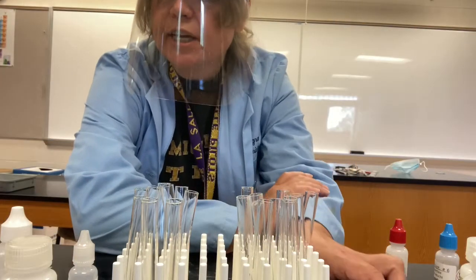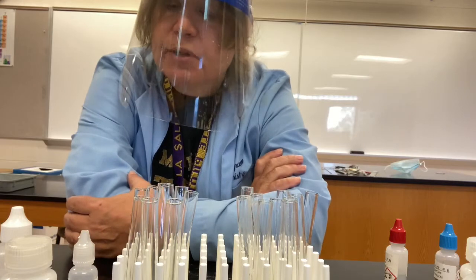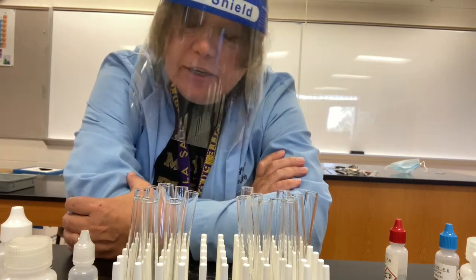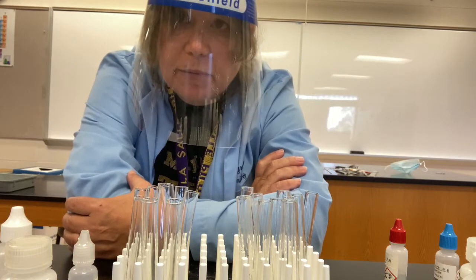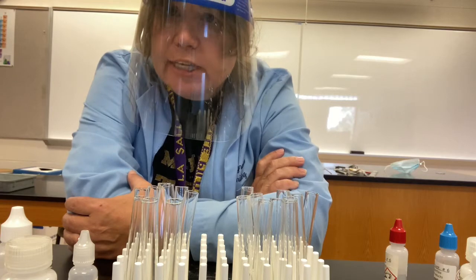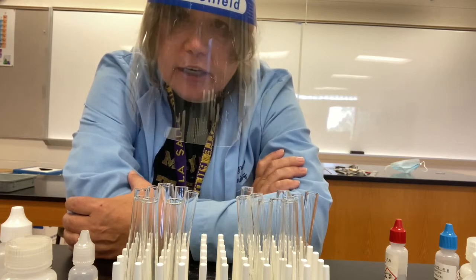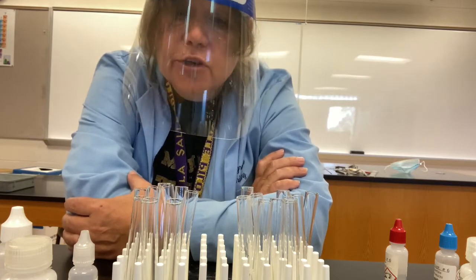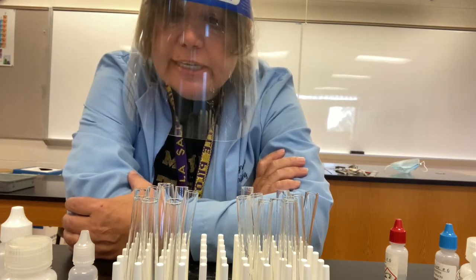Now we'll proceed to the analysis of Epsom salt. Epsom salt is magnesium sulfate heptahydrate, that's how you call that, but we're going to focus on just the magnesium sulfate part. So magnesium sulfate contains magnesium ion and sulfate ion, neither of which we've analyzed for yet, so we're going to do each of those in turn. So the first test is going to be for magnesium.